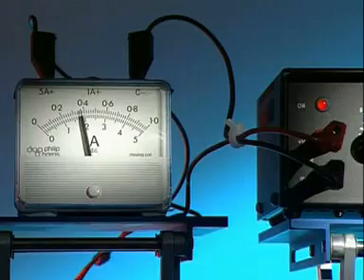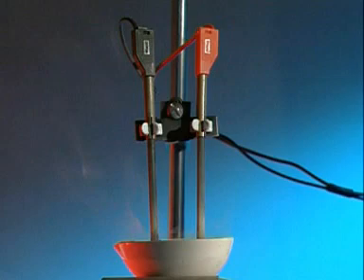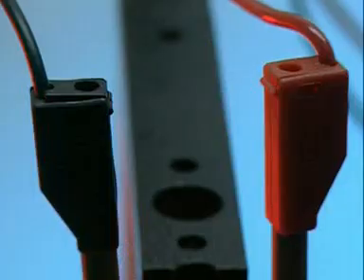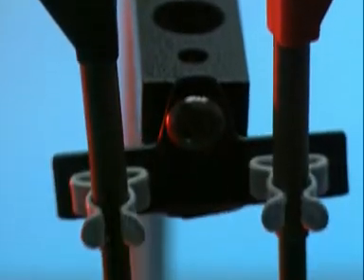Switch on now and a current flows. In this circuit, the electrode on the right is positive. The one on the left is negative. As electricity passes through the molten lead bromide, chemical reactions start.